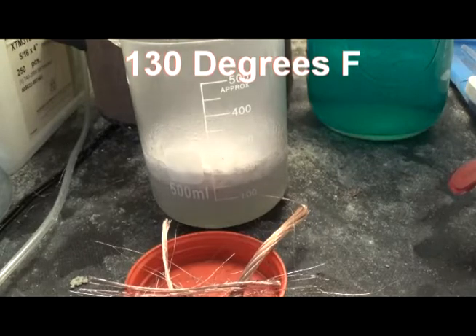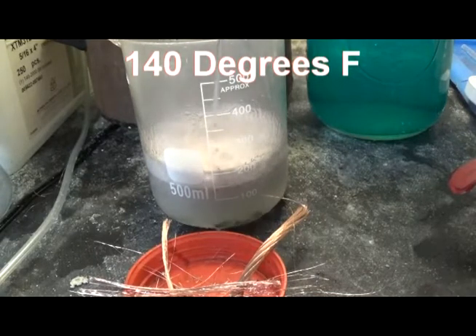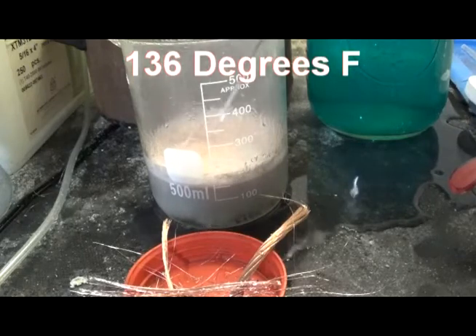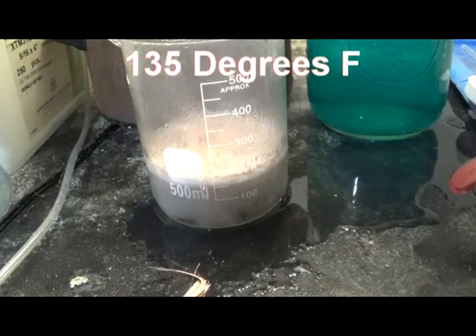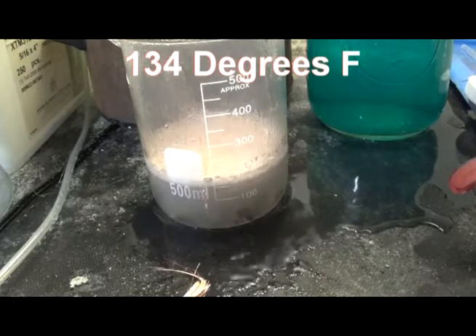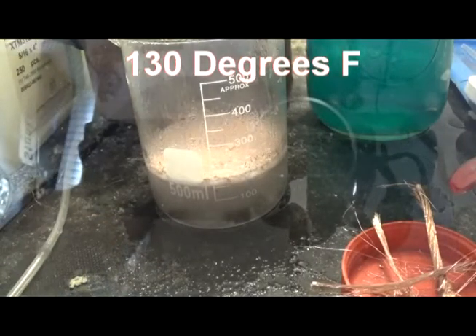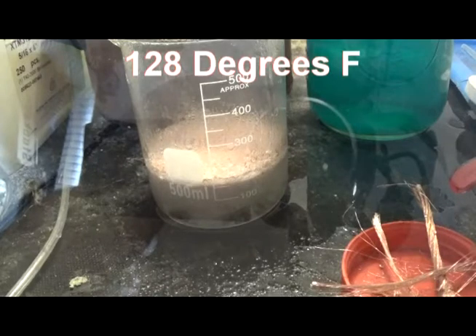Okay, that was kind of unexpected. The copper is too thinly divided. It's getting really hot, so I'm having to just spray the outside of the cup to cool it down. I did not expect it to react that way. It's about ate it up now.